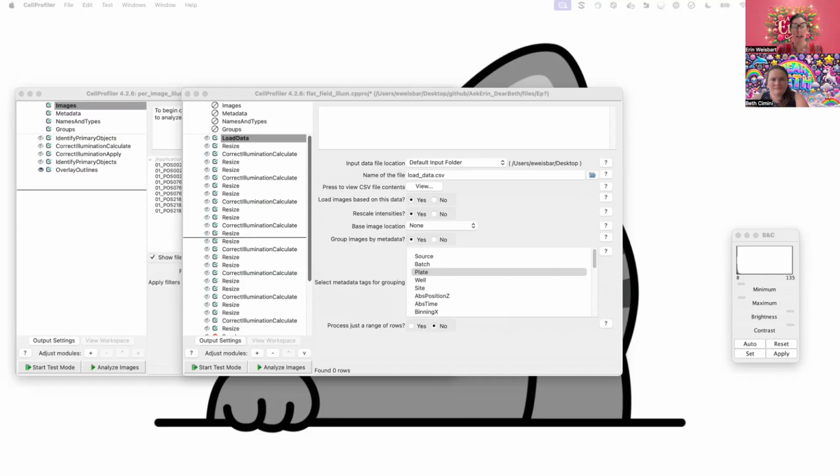So very often images have some sort of vignetting in them. What this means is that generally the center of an image is much brighter than the edges of an image. I was just trying to pull up an example of that really quick, which has to do generally with the light going through in a round fashion, but the actual camera being a square that we are taking a picture of.